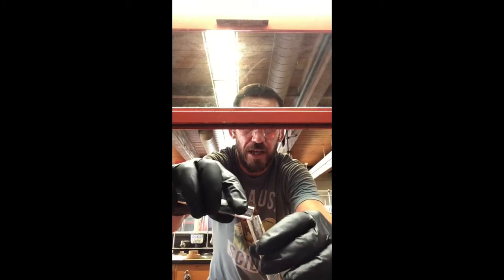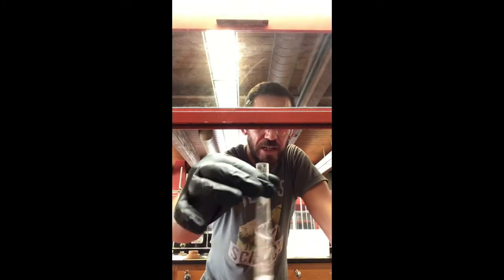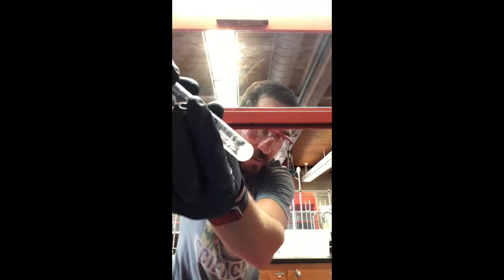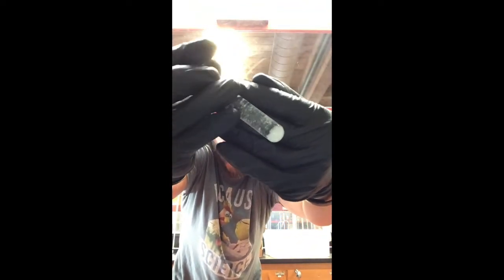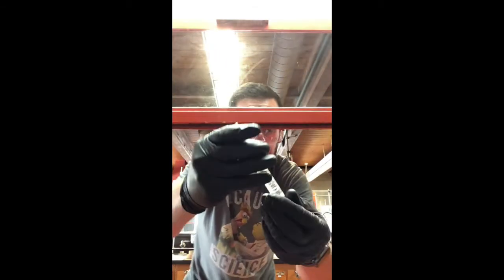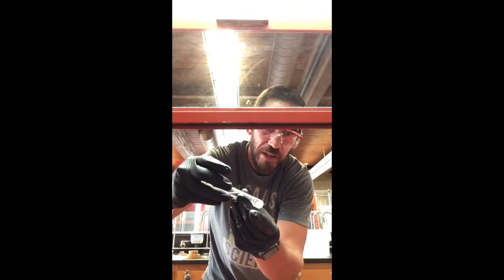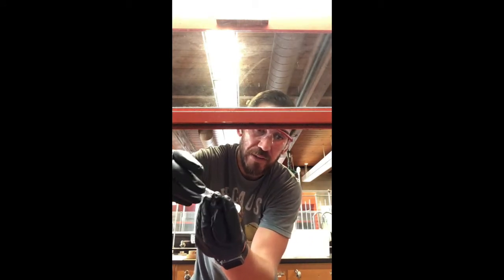Okay, so I did that. I just put it in here just for fun. Now we can give this a little swirl. You can see the stuff is moving around now, right? You can see it bouncing. It might be difficult to see in the video, but we've got some individual particles moving around, and we've also got some clumps moving around. That's good. It's doing its job. It's absorbing the water.